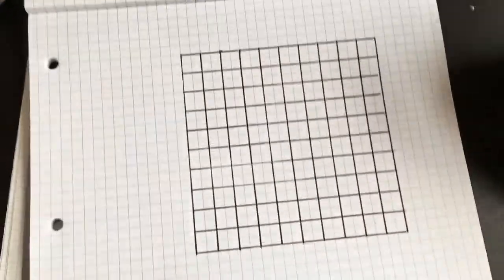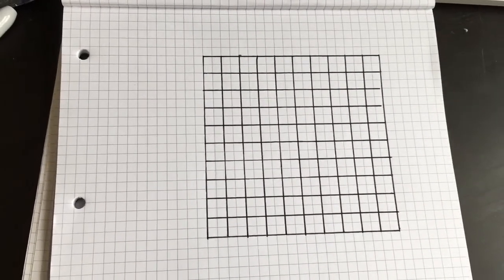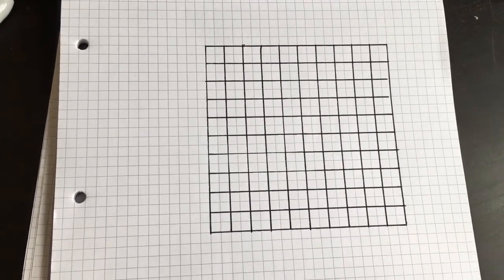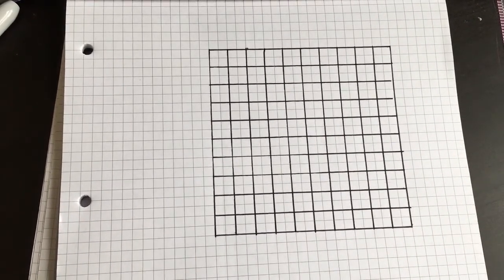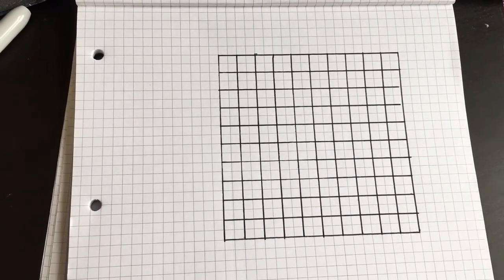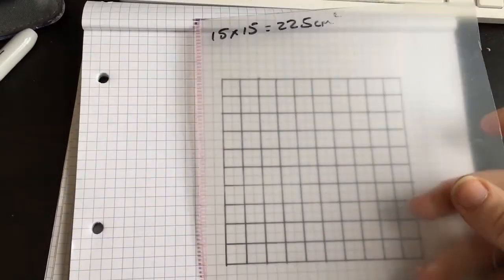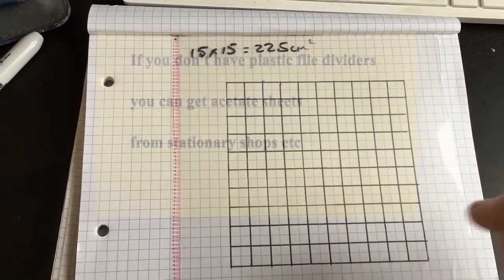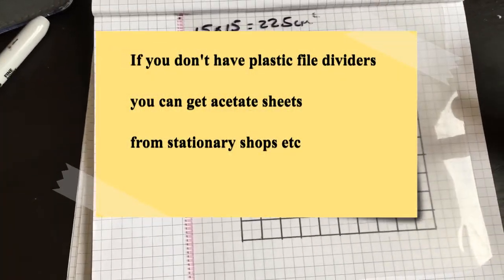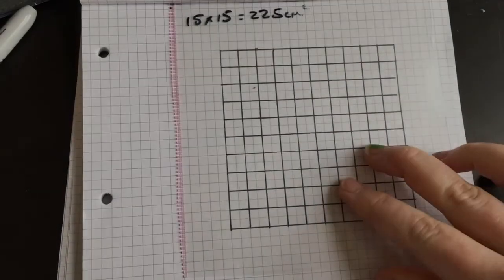I'm going to be showing you how to make your own quadrat out of scrap materials that you may have lying around the house, or potentially out of something that you can buy relatively easily from stationery shops or online retailers. Essentially, all you really need is some sort of somewhat clear plastic, and what I've used for this is the divider for a file. Now what you need to do is draw a template for yourself to trace.